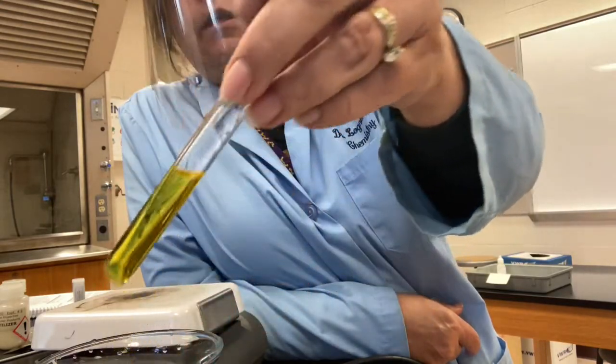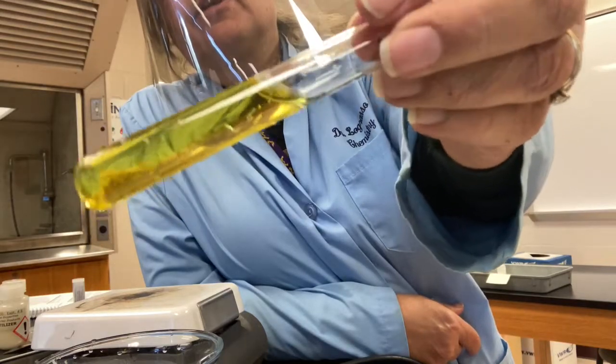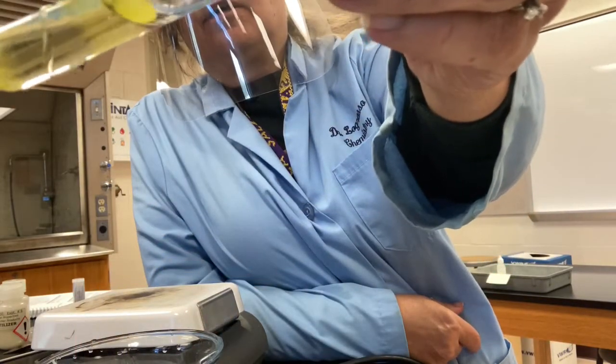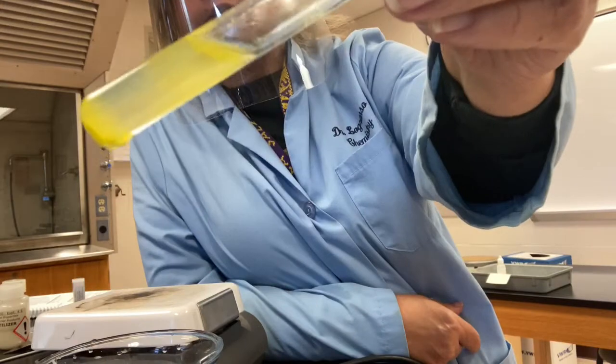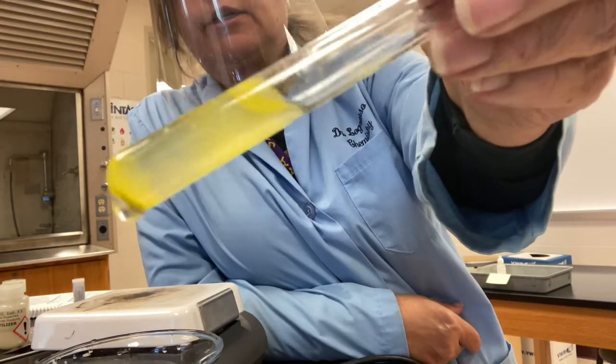And it does not look like I'm going to get one today, folks. So it is possible that this detergent did not have phosphate in it, but definitely we see it in the fertilizer where we see that cloudiness in there. That's precipitate. And then, of course, we expected to see it in the sodium phosphate because we purposely added it into the sodium phosphate.